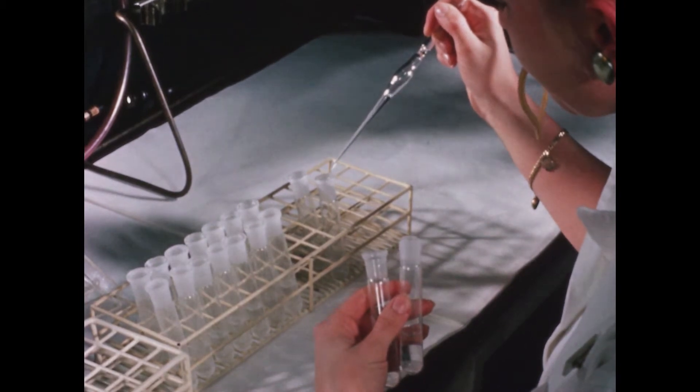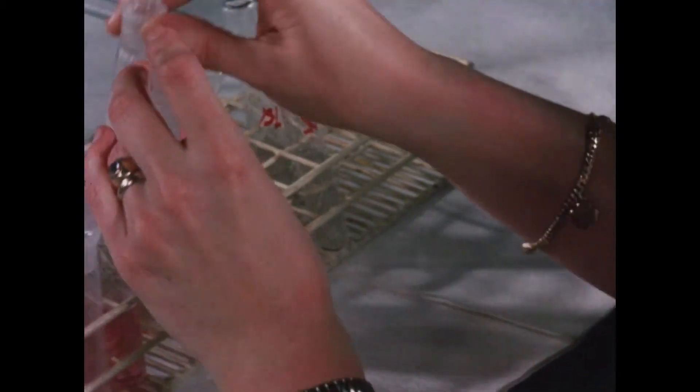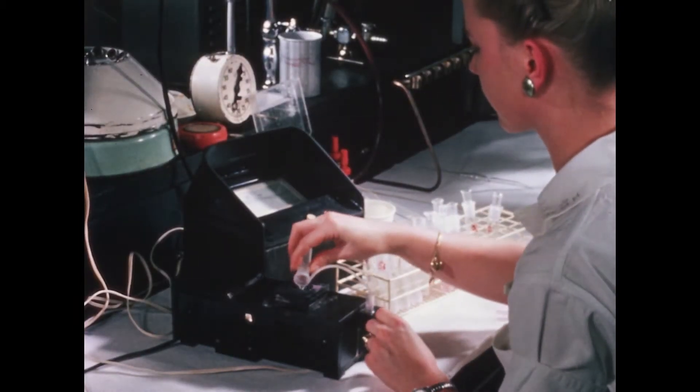Some stages of the analysis are shown here. The method is colorimetric with final reading on a filter photometer.